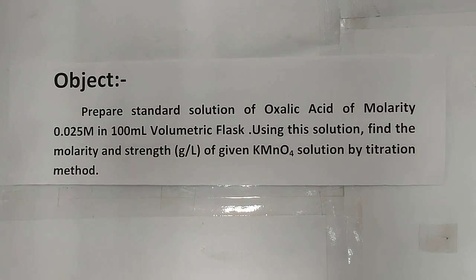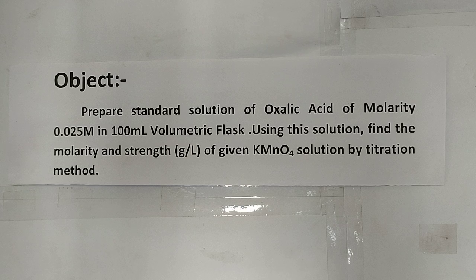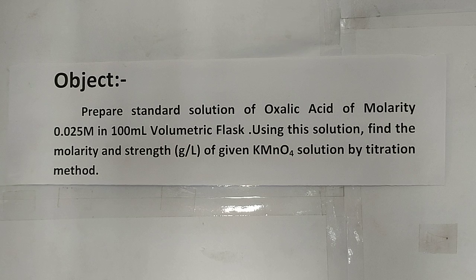Prepare standard solution of oxalic acid of molarity 0.025 M in 100 ml volumetric flask. Using this solution, find the molarity and strength in grams per liter of given KMnO4 solution by titration method.